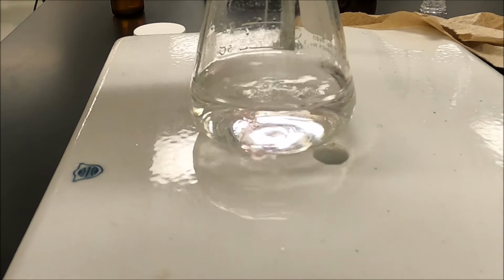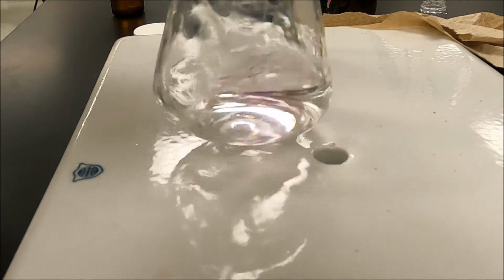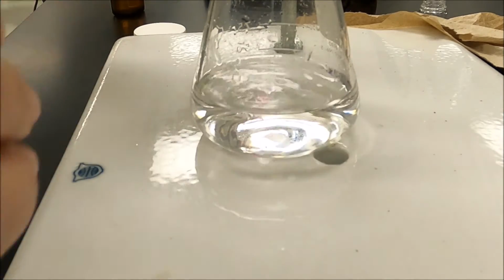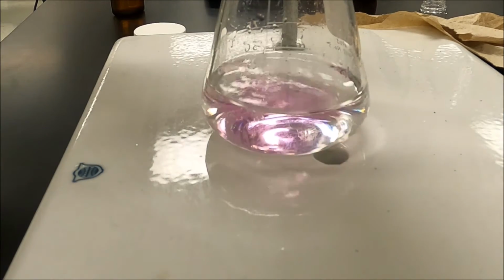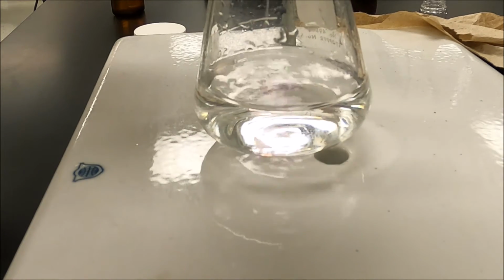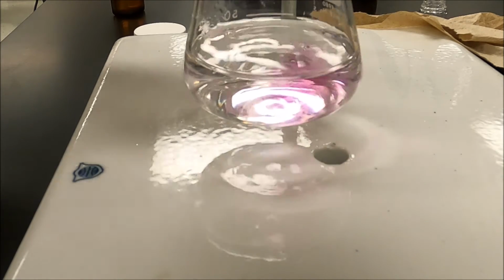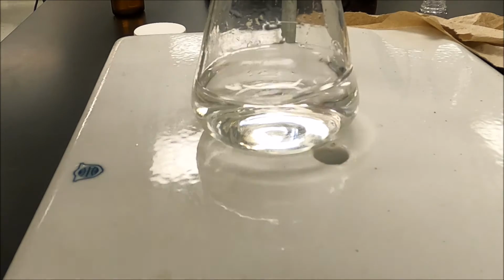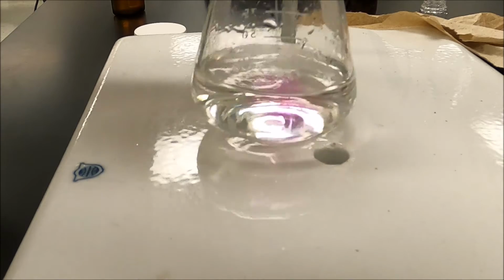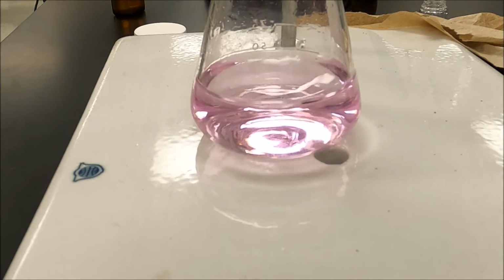Okay, it's showing up gradually, means I'm getting close. Okay, we have hit endpoint.